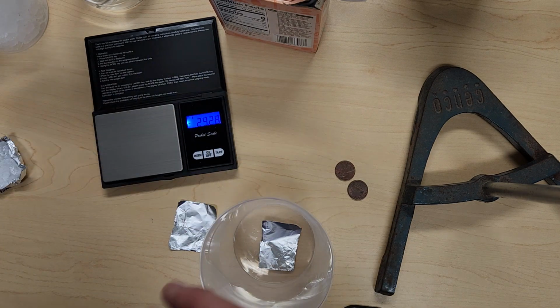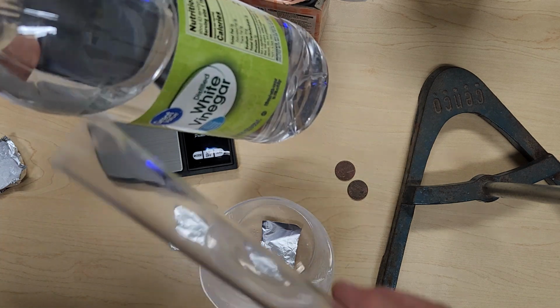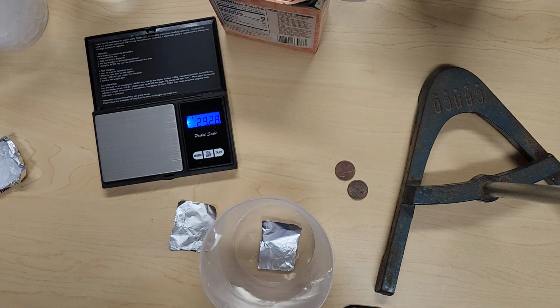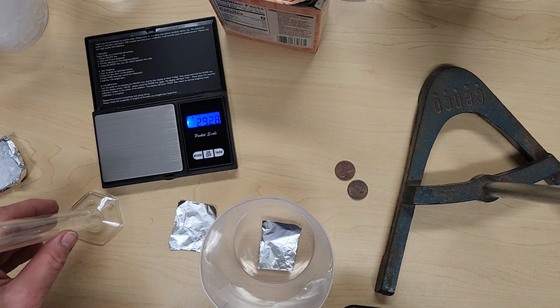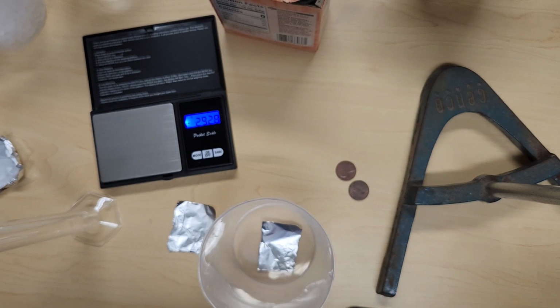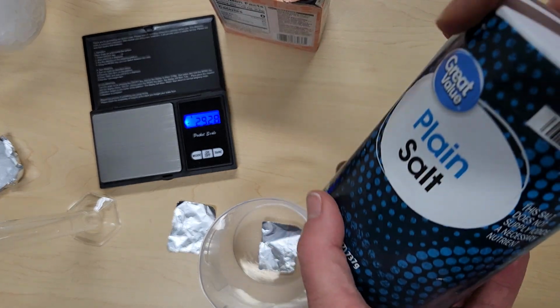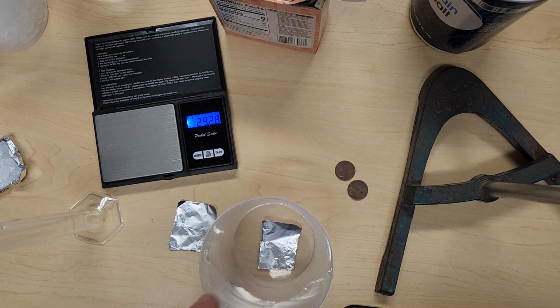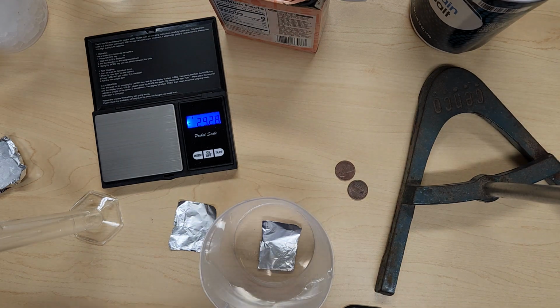Okay. Then we're going to put that same piece of aluminum foil after we've made our observations. We're going to add vinegar. So we're going to add the amount of vinegar using our graduated cylinder into that beaker. We are going to weigh out some salt. So you can take some salt, use our balance to weigh out the amount recorded, mix that vinegar and salt together, and wait 10 to 15 minutes.